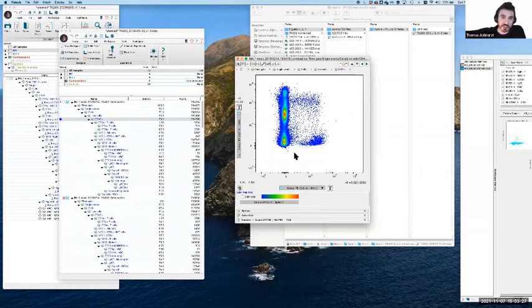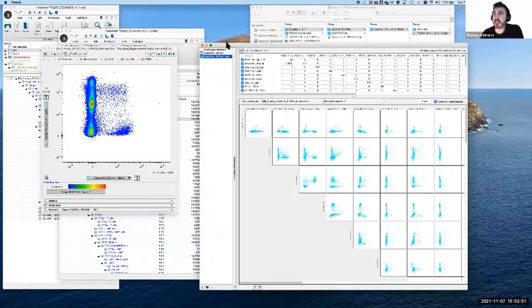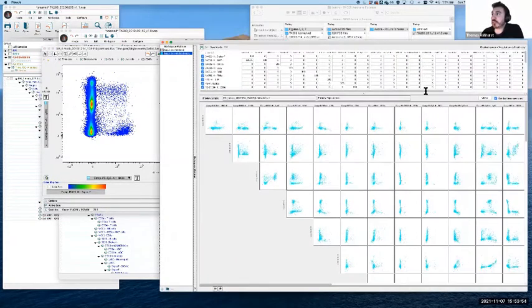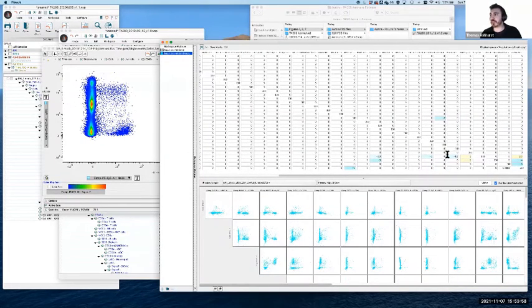But the way that we got there is potentially much more elegant. It's taking the entire spectral signal from each of those colors and integrating them together. But what you get to see is something that looks like conventional cytometry data. Now, you can have, at this point, over or under extraction, but it actually will look the same. And if you interact with this data in FlowJo, it will look exactly the same. But the key difference here is that in FlowJo, you have a matrix which is full of zeros.